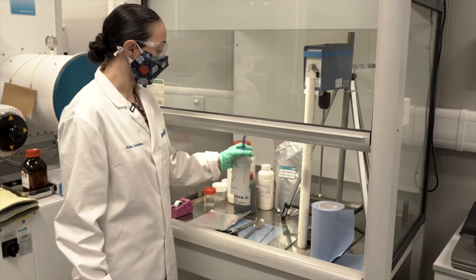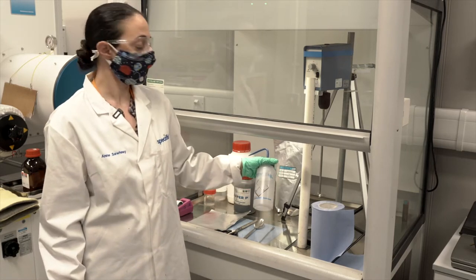Throughout, I'll clean up, and as my solvent, I'll use distilled water.